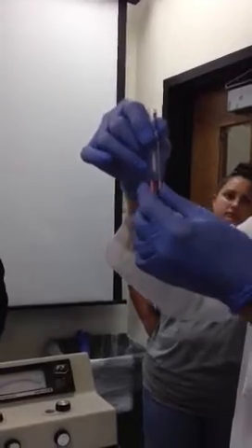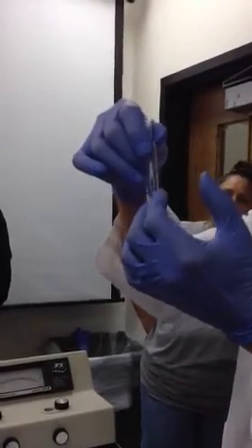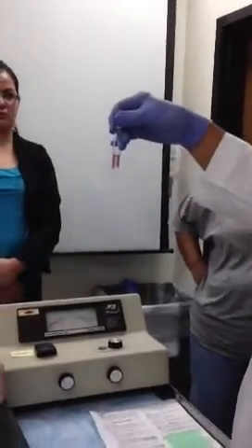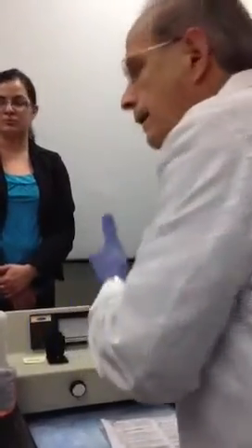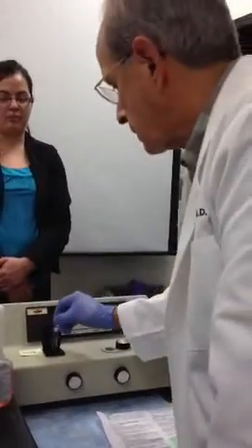No, it could just be anything. We could compare it to anything. It just happens to be 200. All right? Now, what we want to know is how does this thing transmit light? Or what's its optical density?